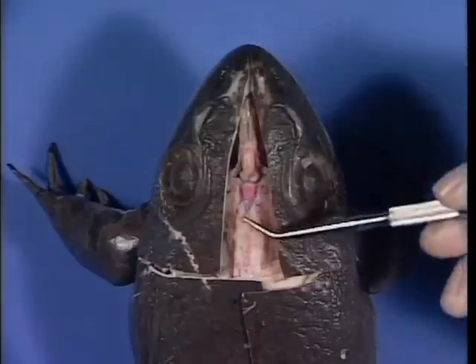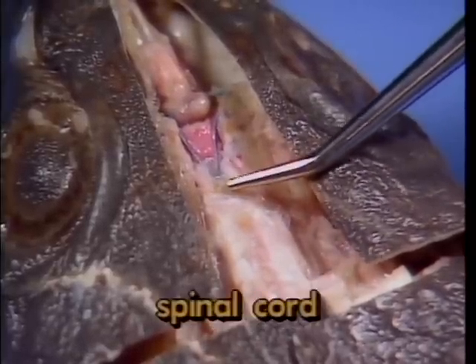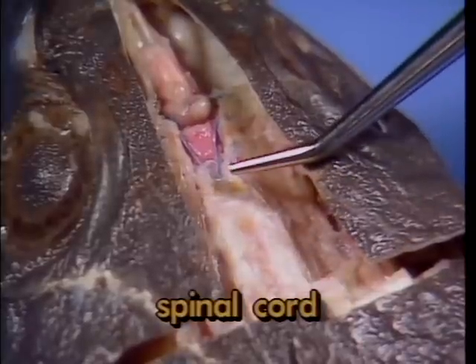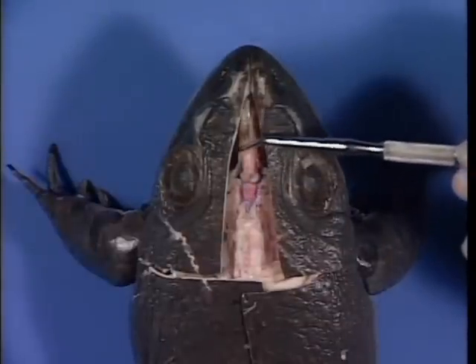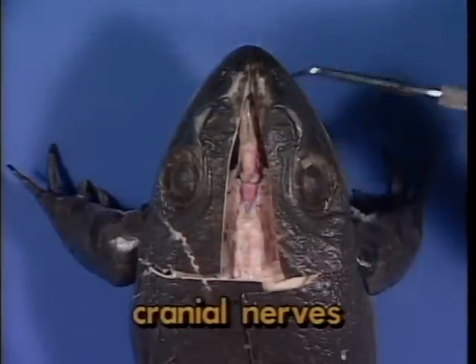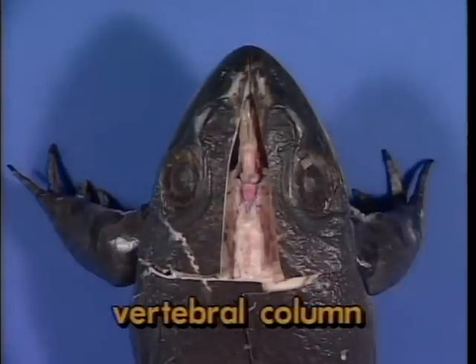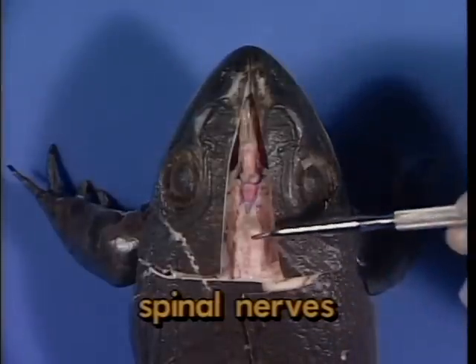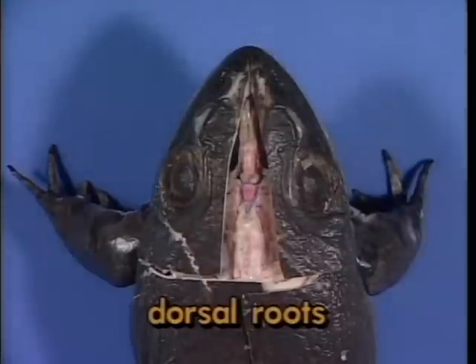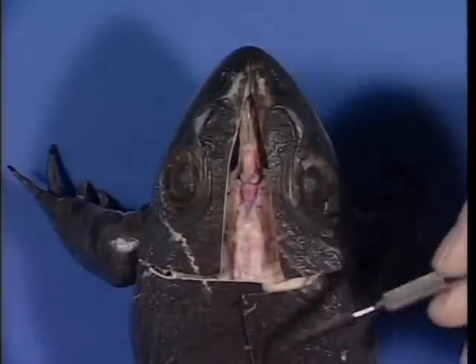From here, the brain tapers in size and becomes a series of nerve fiber tracts which exit the cranium or skull as the spinal cord, not visible here. Although they cannot be seen here, all along the length of the brain are 10 pairs of nerves which are connected to the brain. These are the cranial nerves. Outside the brain, along the vertebral column, is another set of paired nerves called the spinal nerves. These nerves carry information inward toward the brain through dorsal roots. Another series of ventral roots carry output signals to the muscles from the brain.